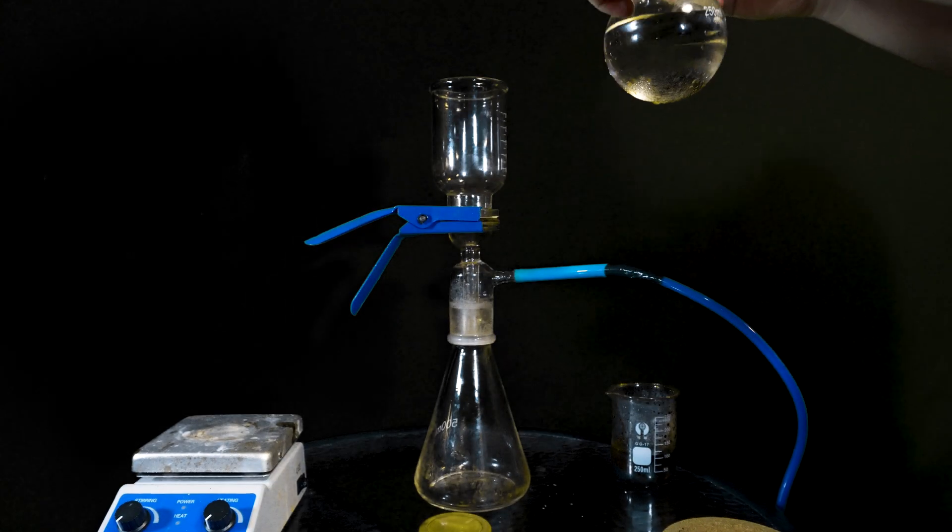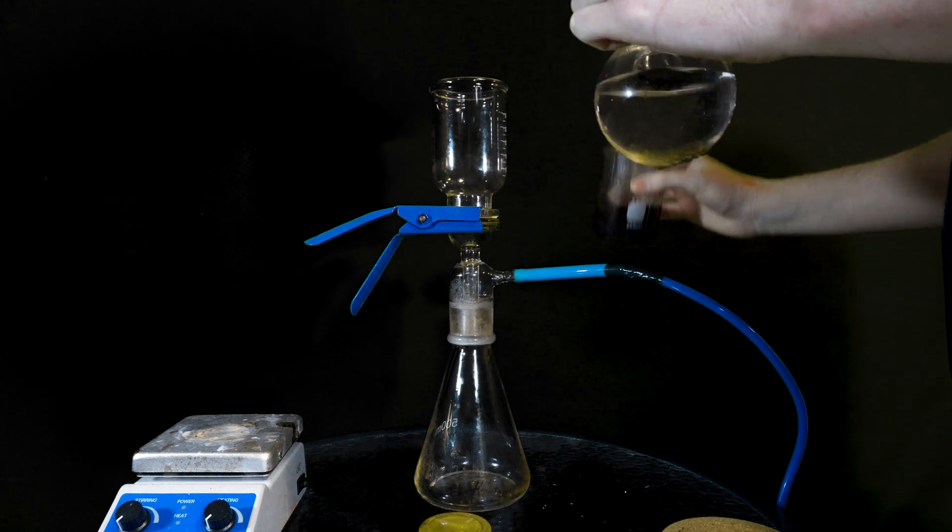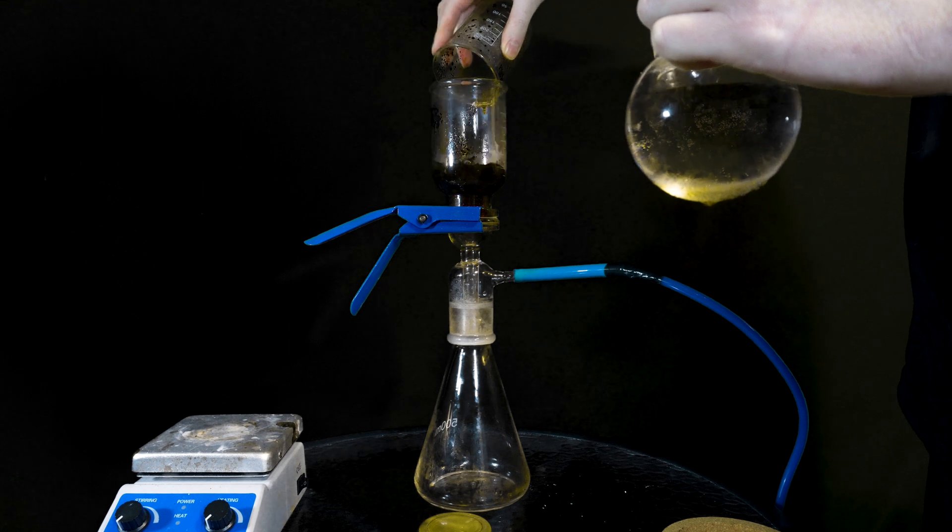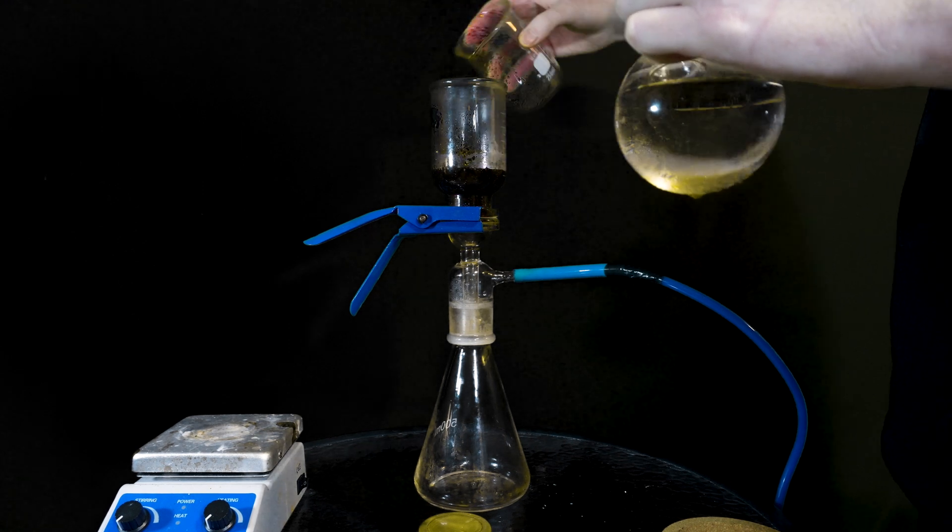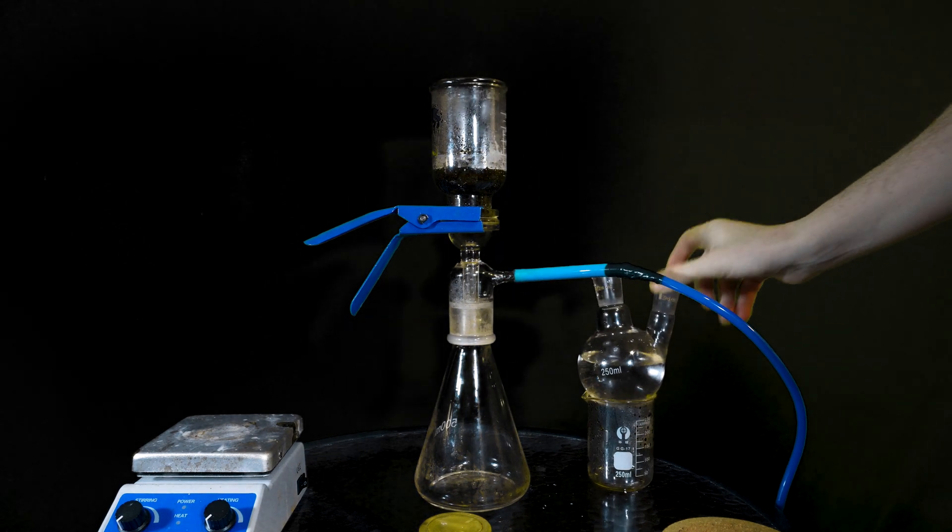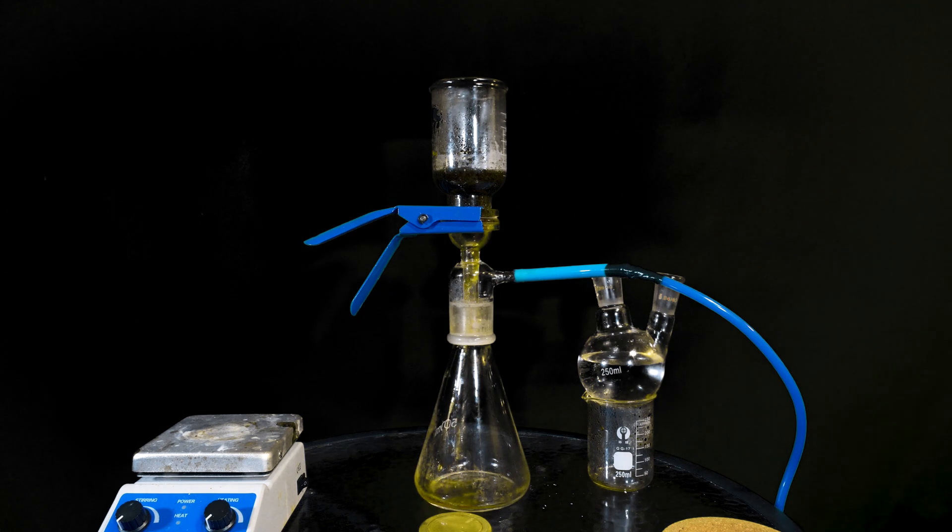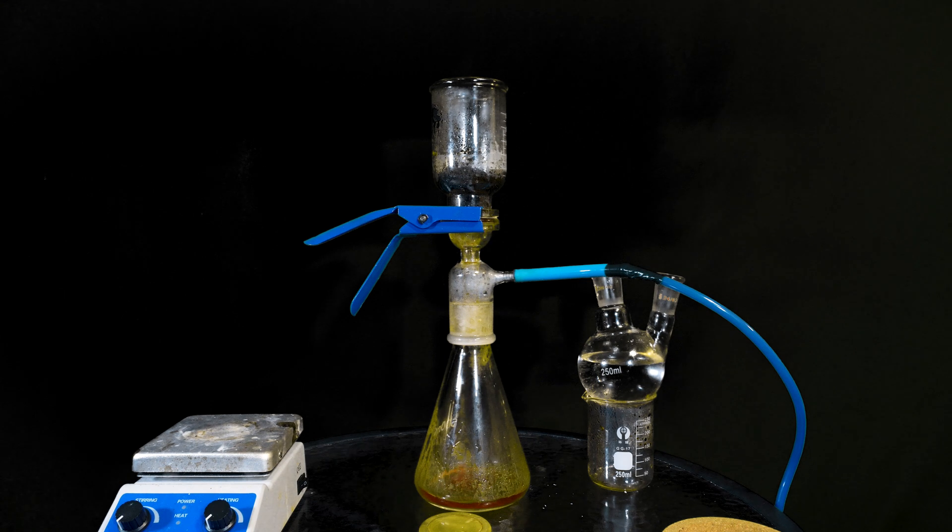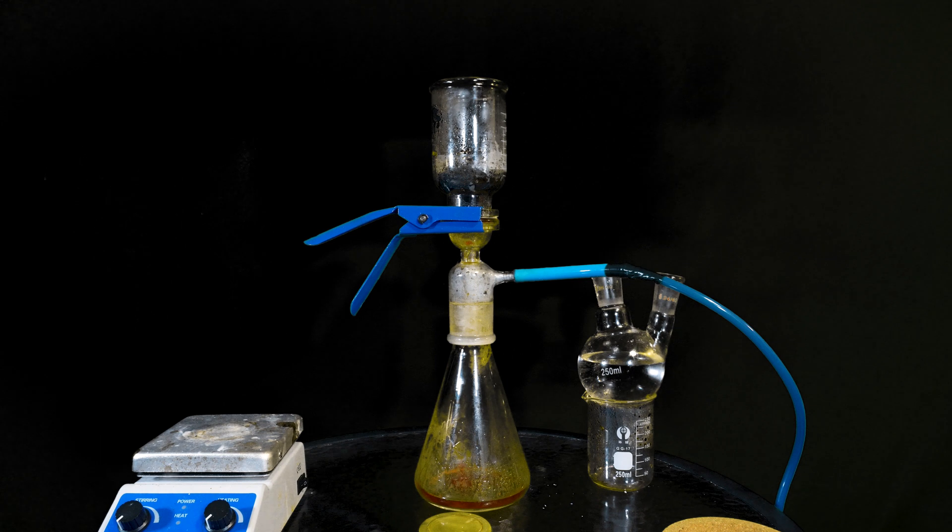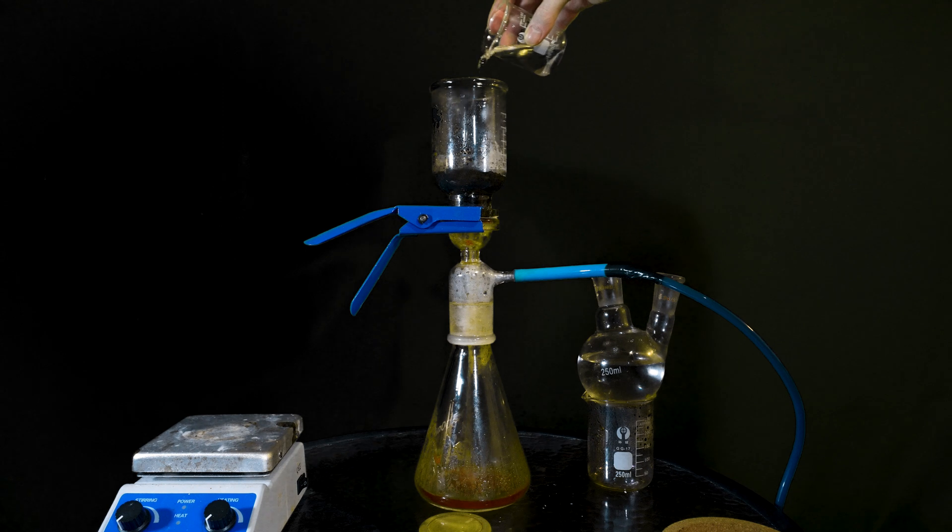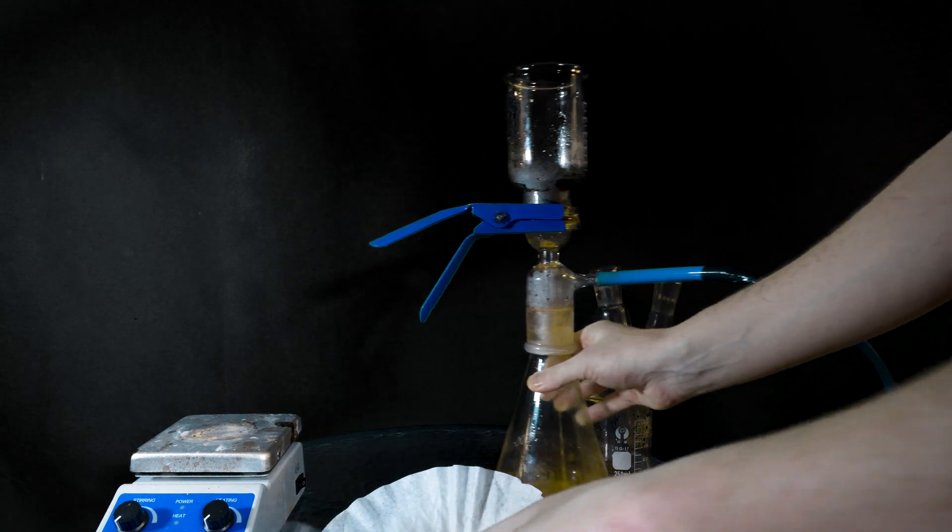Next we'll vacuum filter the iodine. It helps to have some cold water available or to put some in the fridge beforehand. Next we'll wash with a little ice cold water and then dry thoroughly on the, that's right, the coffee filter.